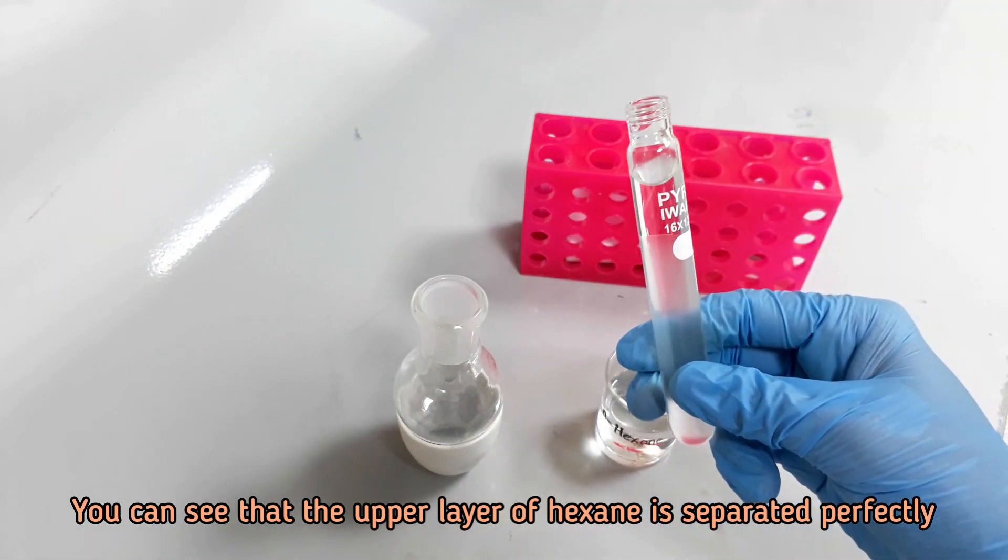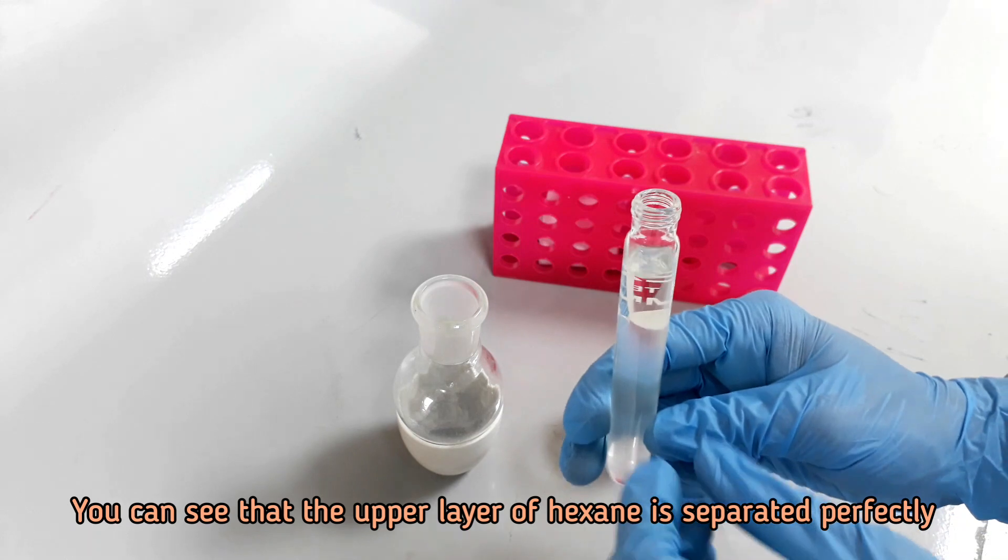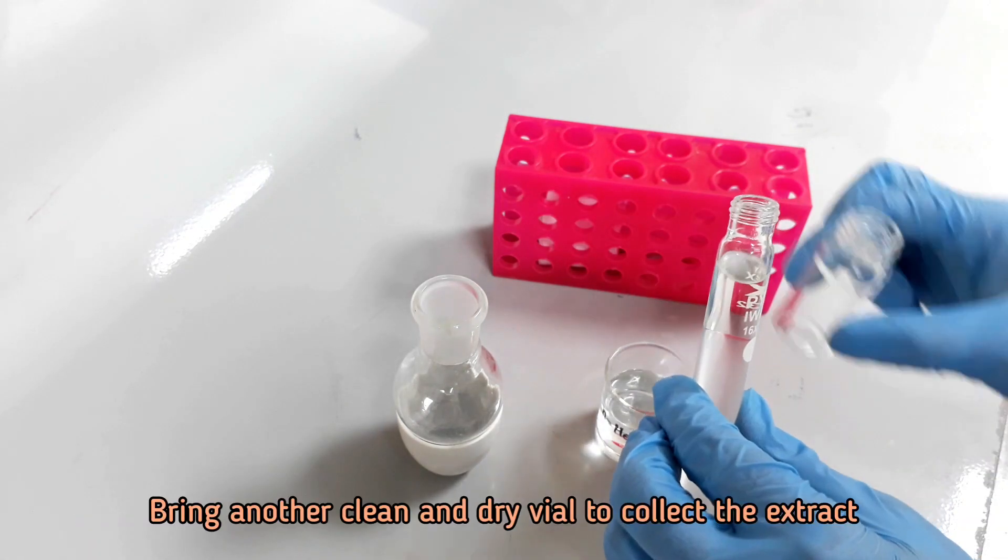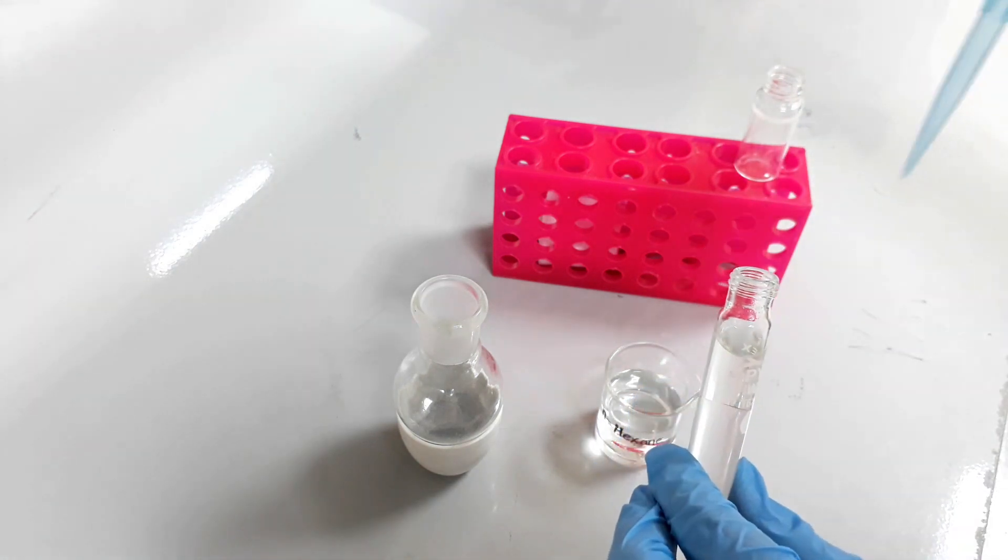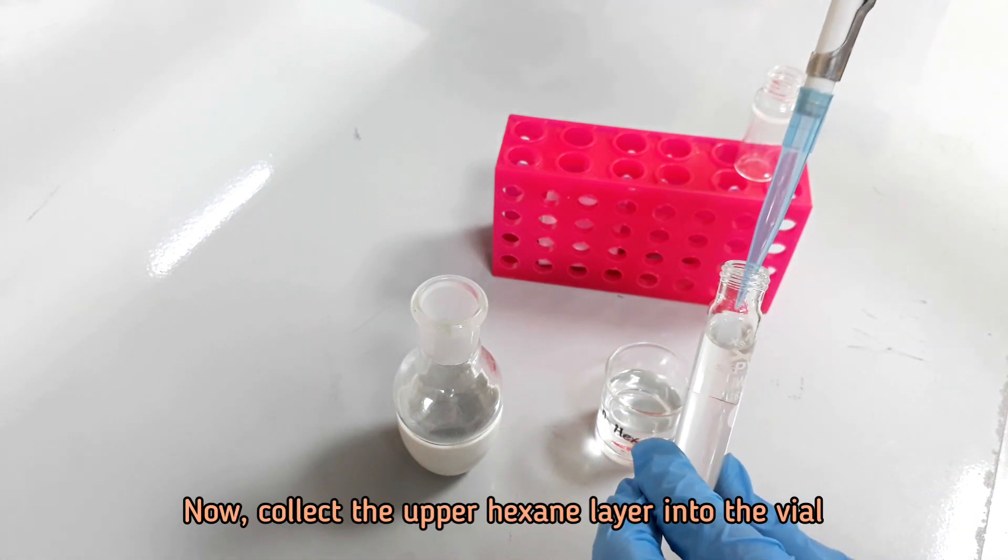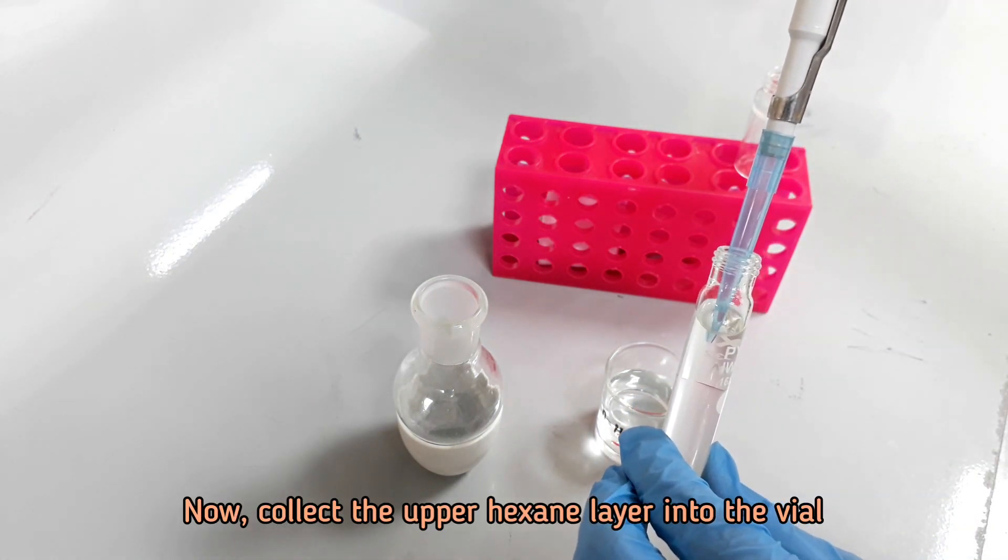You can see a clear and separated hexane layer at the top of the solution. Now, collect the hexane layer into another dry vial.